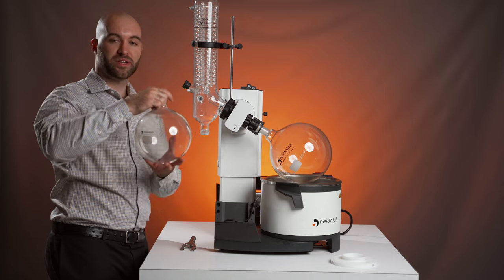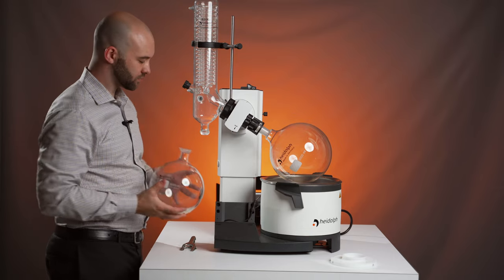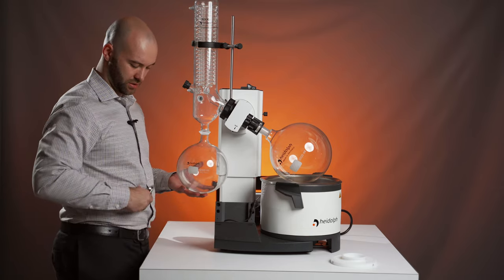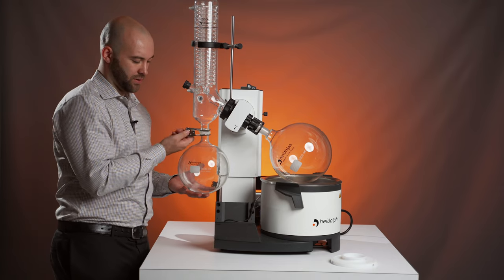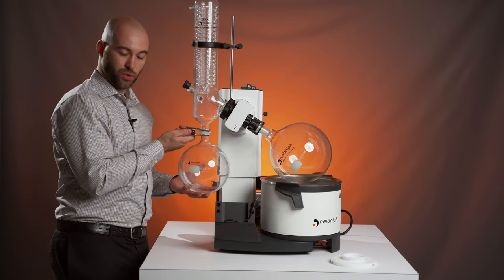Following that, you can attach our three liter flask. It connects to this ball joint with a clamp that you can tighten so it will not open.